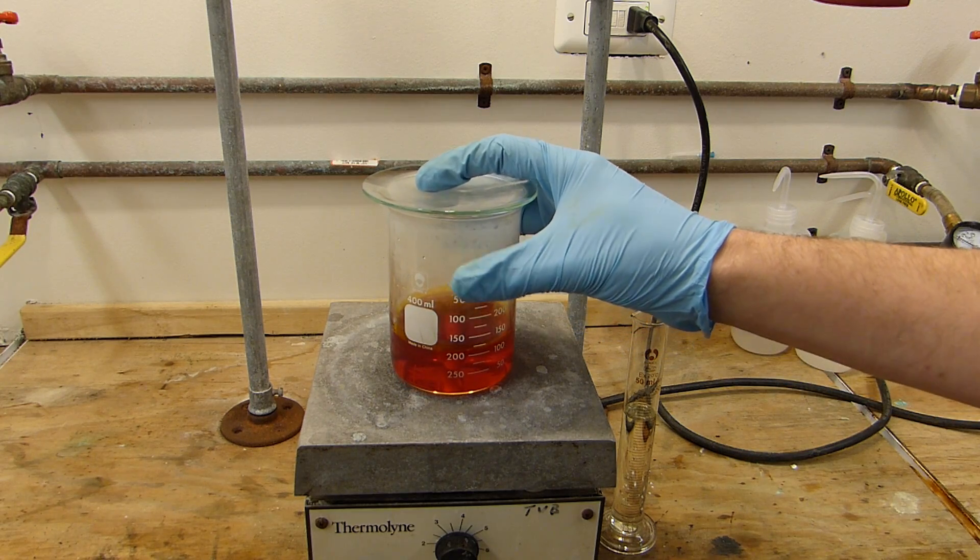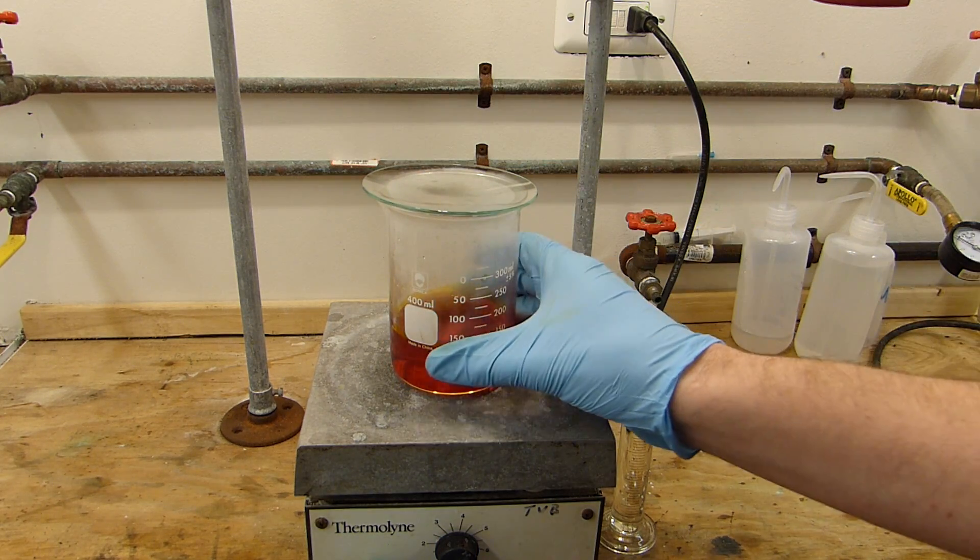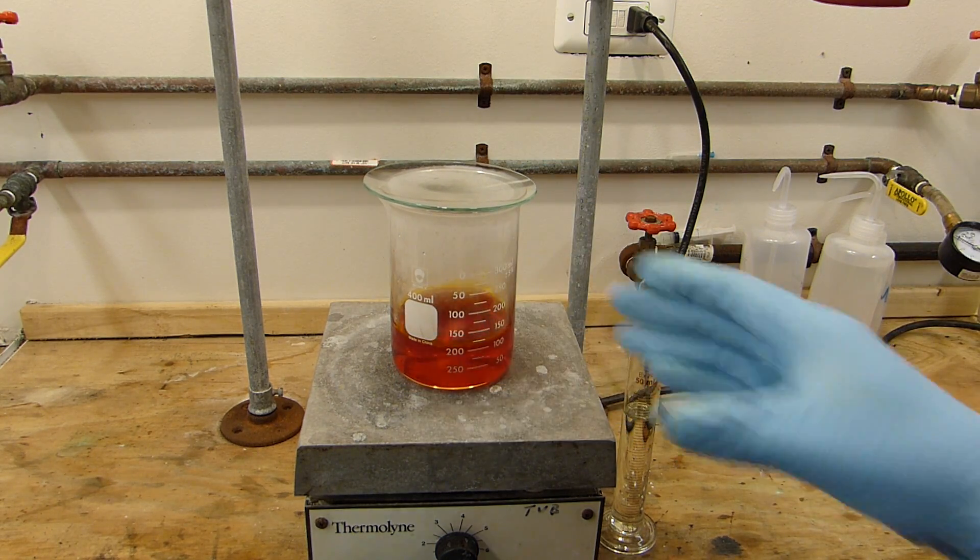Okay the solution of chlorochromic acid has cooled sufficiently. It's now down to a little less than zero Celsius. Kind of overshot but that's not a big deal.